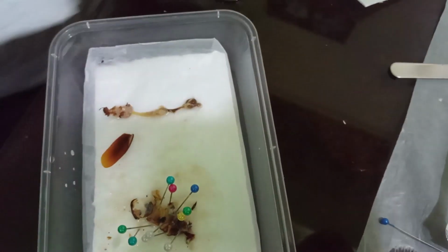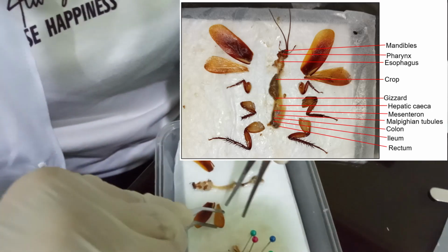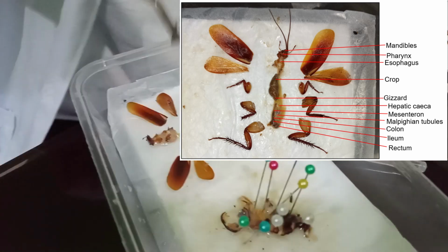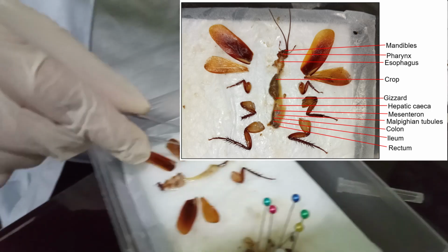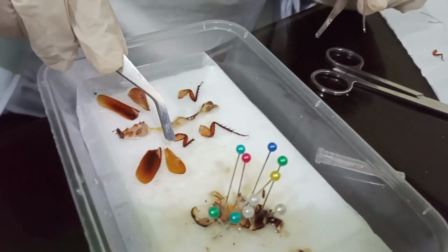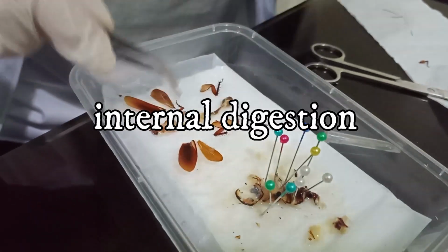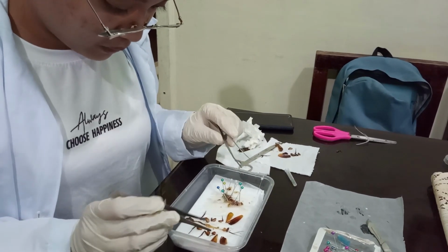The observed digestive structures of the cockroach are the pharynx, esophagus, crop, gizzard, hepatic ceca, mesenteron, colon, Malpighian tubules, ileum, and rectum. The digestive tract of a cockroach is a tube modified into subdivisions, which serve specialized digestive functions such as food reception, conduction and storage, internal digestion, absorption, conduction, and formation of feces.